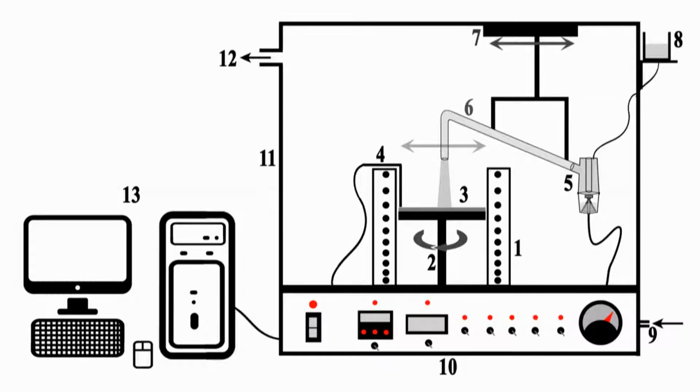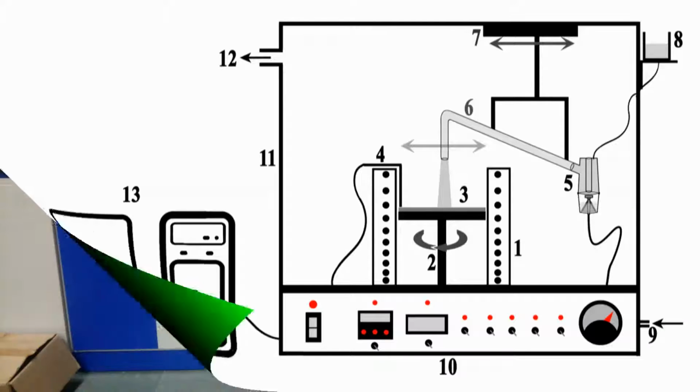This compartment is ventilated with an exhaust to avoid vapors reaching the operator. Since the nebulizer can be filled with 5 ml of precursor only, the nebulizer feeding arrangement is provided outside the compartment. The unit has a front panel for monitoring purposes and also for sudden manual override control of a particular operation during the deposition. A pressure gauge is also provided on the front panel to monitor the gas pressure.